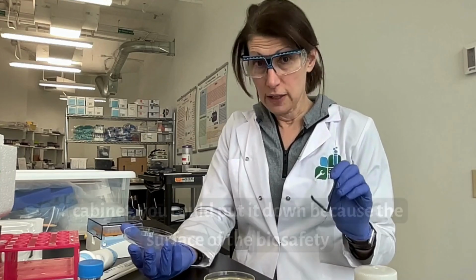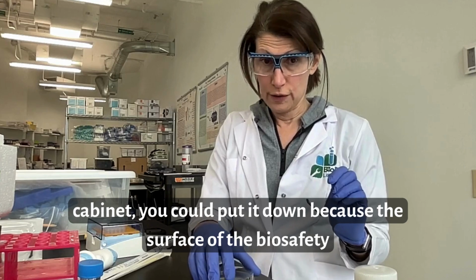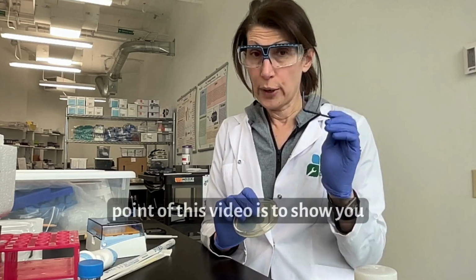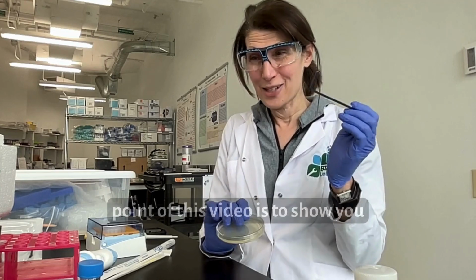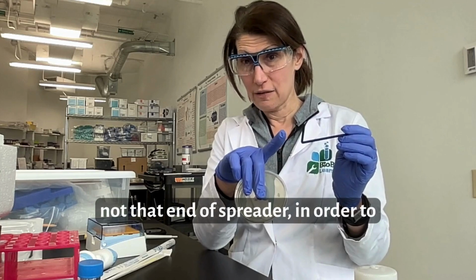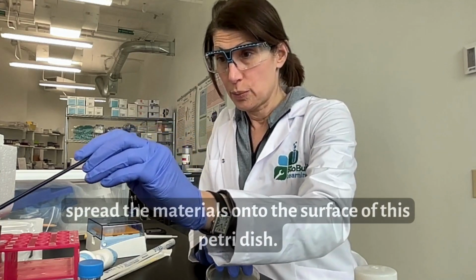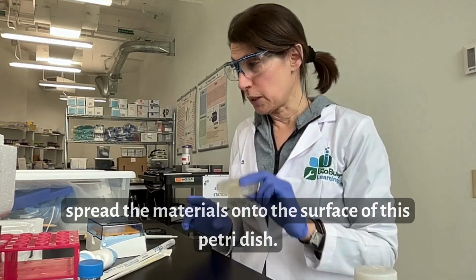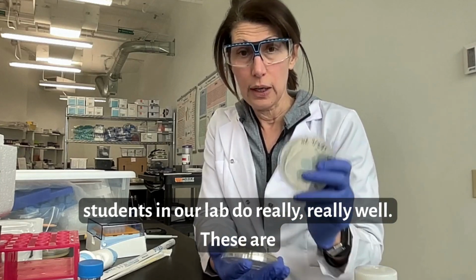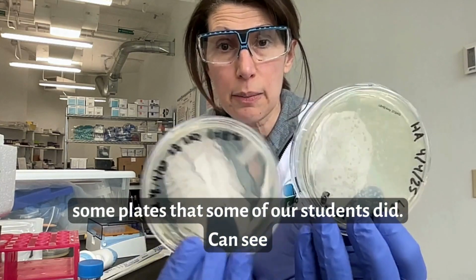If you're in a biosafety cabinet, you could put it down because the surface of the biosafety cabinet has been sterilized. But the point of this video is to show you that I can touch this end of the spreader, but not that end of the spreader, in order to spread materials onto the surface of this Petri dish. So that is spreading onto the surface of a Petri dish, and our students in our lab do it really, really well. These are some plates that some of our students did.